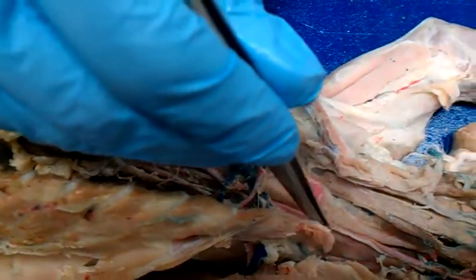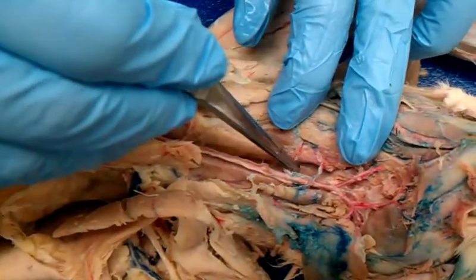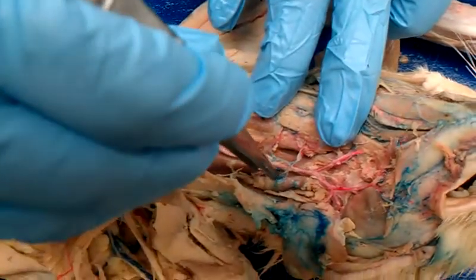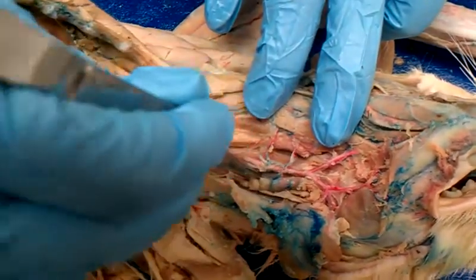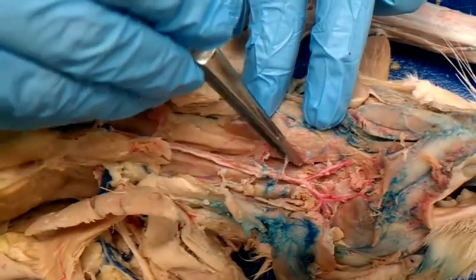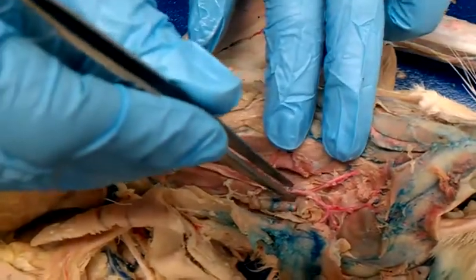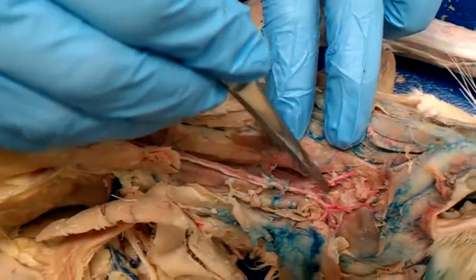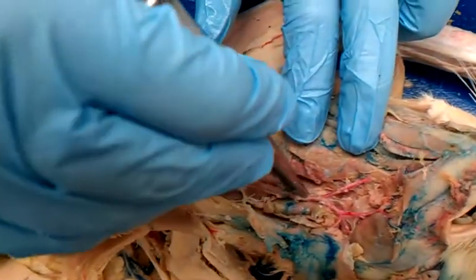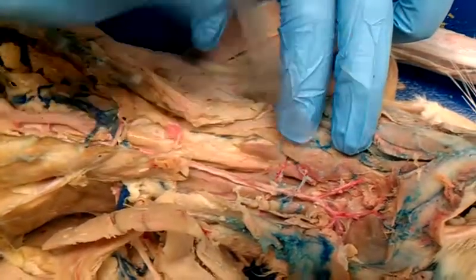If you follow the left common carotid up, we have the superior thyroid, and opposite of that is the muscularis. It's over here, I can't really get it. Muscularis. Then this is going to be our lingual. It's kind of broken. And then if we follow that up, we have our, oh, just kidding. I would say that's laryngeal. Yeah. This is laryngeal. Because it goes to the larynx, not lingual.